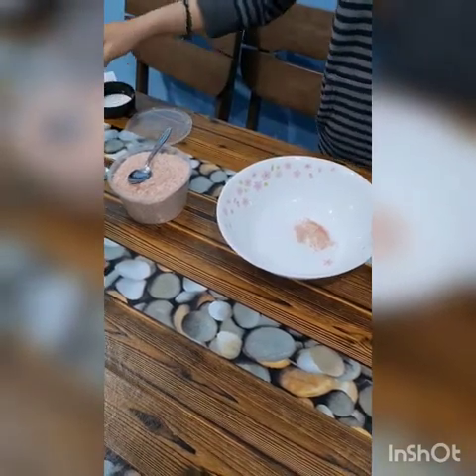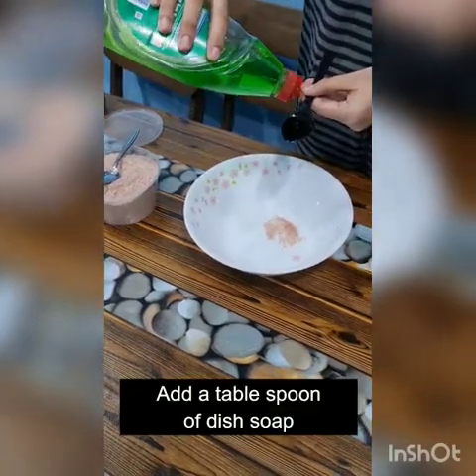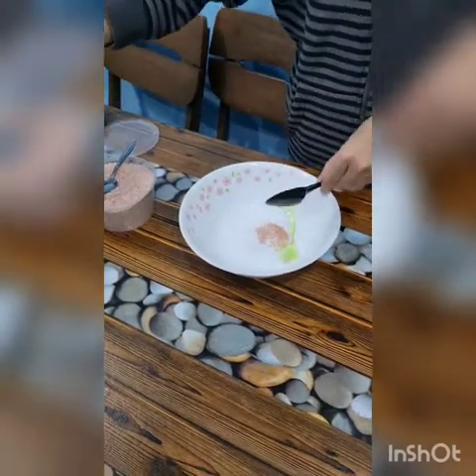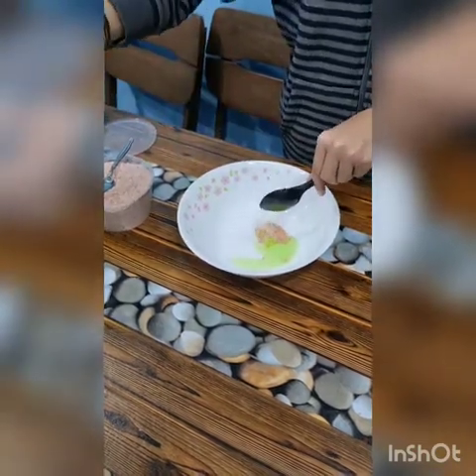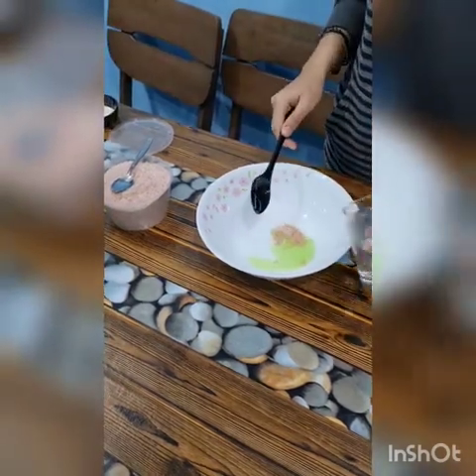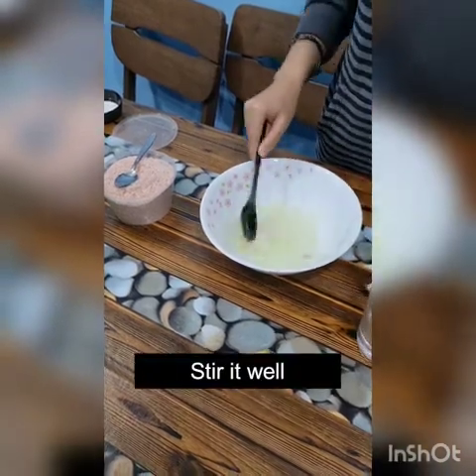and then a tablespoon of dish soap was added to the salt. And then half a glass of water was added to the mixture and was stirred well.